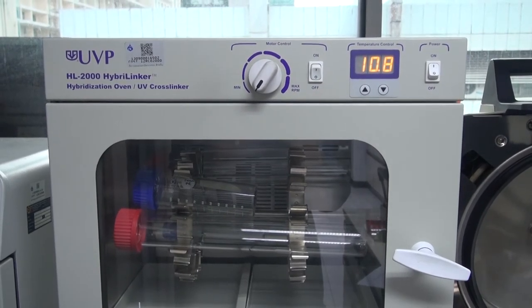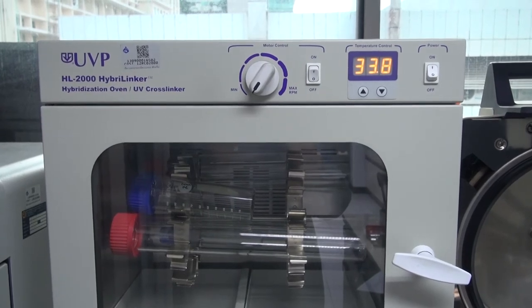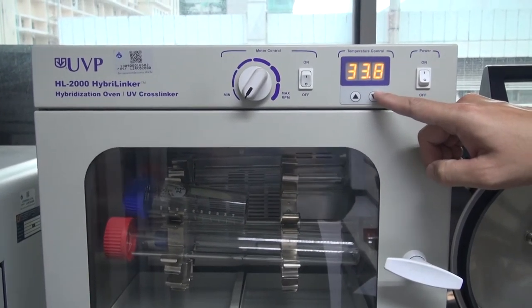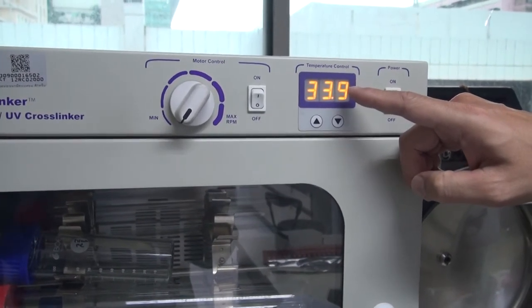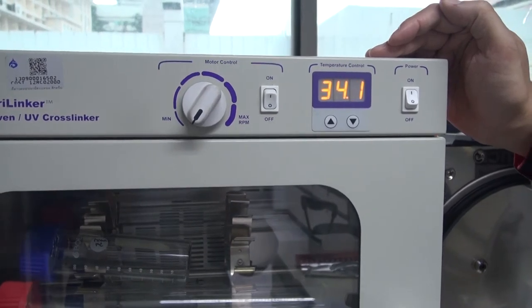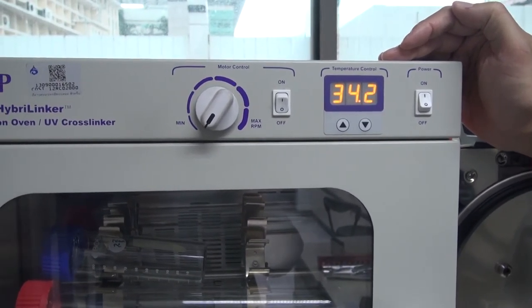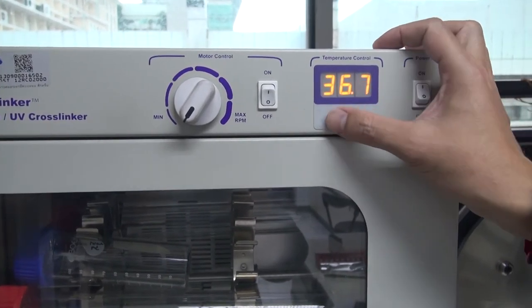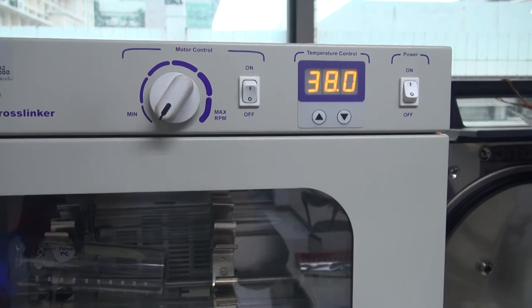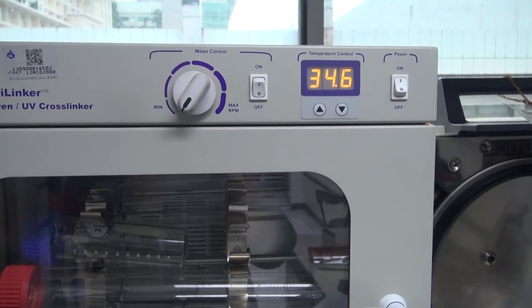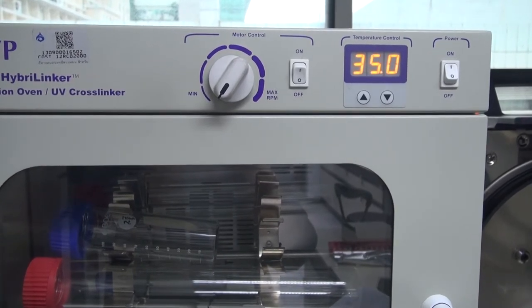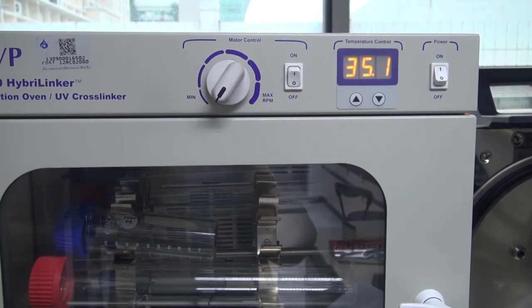Temperature of the oven can be adjusted with a keypad. To adjust the temperature setting to the desired degree, press either up or down button below the temperature control display to raise or lower the display degree which is in degrees Celsius. The setting is adjustable from 10 degrees Celsius plus ambient to 99.9 degrees Celsius. When the desired set point is reached, wait for five seconds approximately without pressing either button. The display will then revert to normal mode showing the actual temperature. The chamber will be cooled or heated up to reach the set temperature.